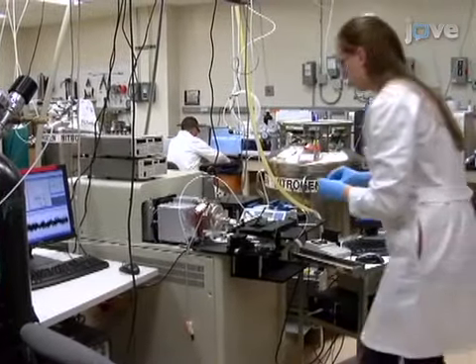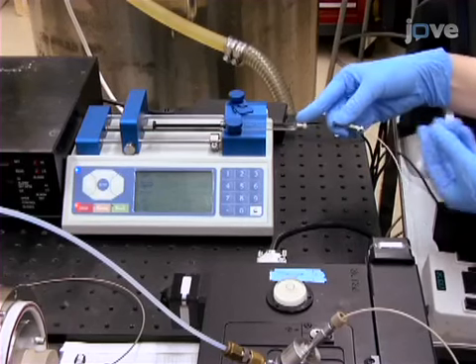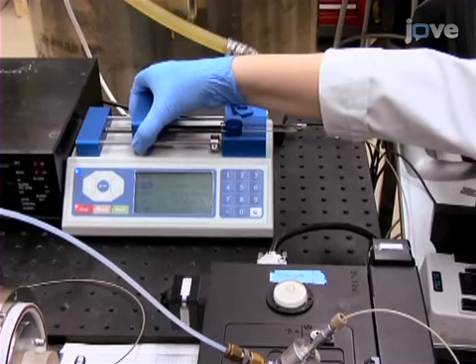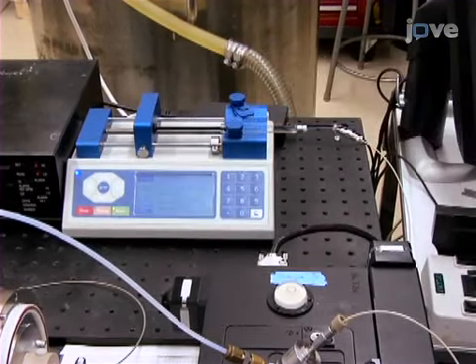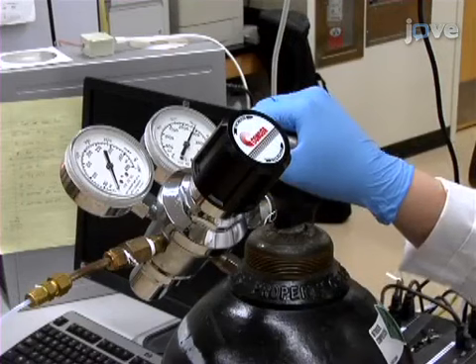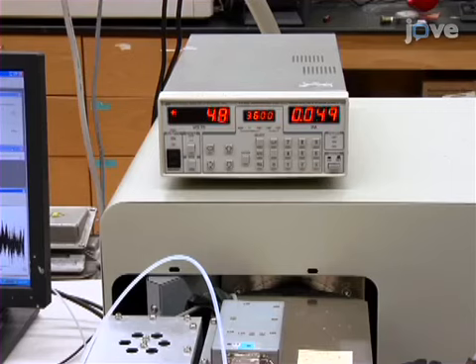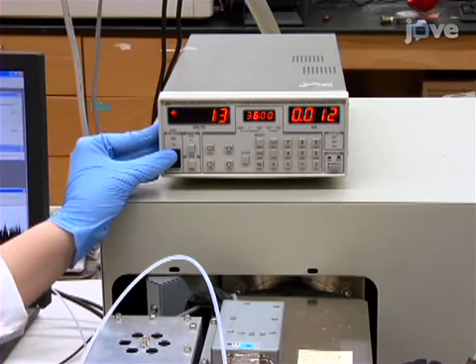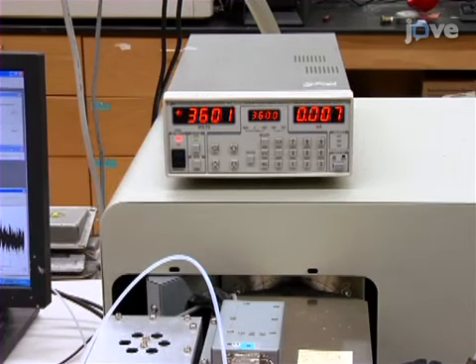Prior to starting this procedure, mount the tissue on a microscope glass slide. Using acetonitrile with 1% acetic acid as the DESI solvent, turn on the syringe pump with a flow rate of 5 microliters per minute. Once the solvent appears dripping out of the DESI source tip, turn on the nitrogen nebulizing gas with a pressure of 160 psi. Then, turn on the high voltage power supply connected to the ion source, applying 3600 volts.